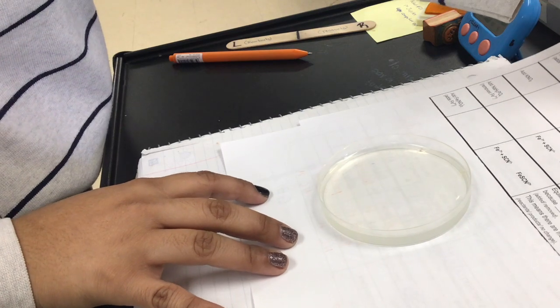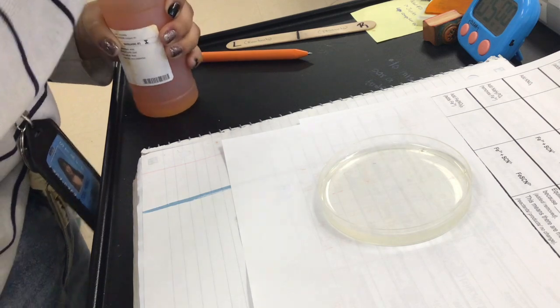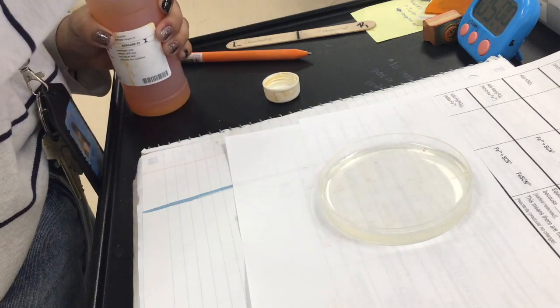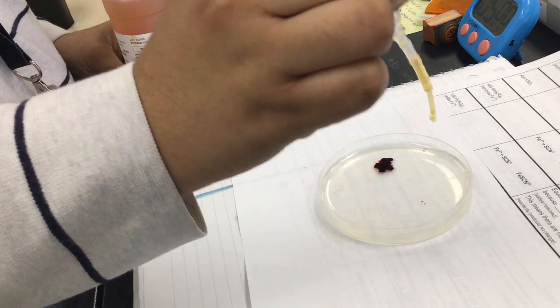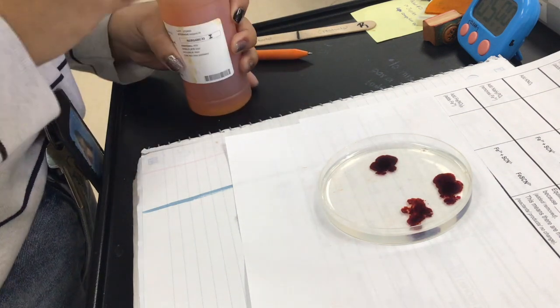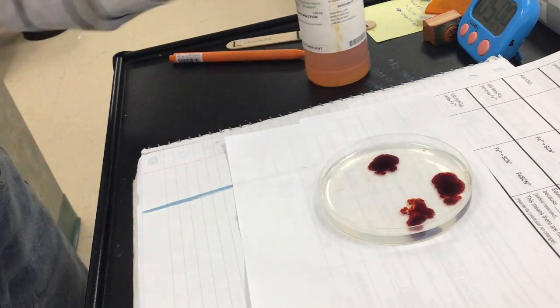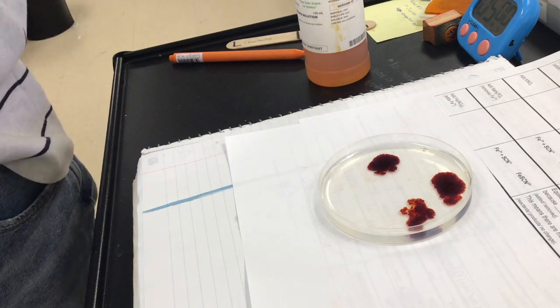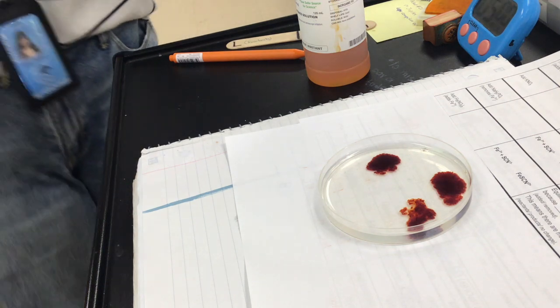Okay, so for our next one, we are going to add Fe, so iron nitrate, to add a little bit more of Fe ions. Okay, so I'm not gonna swirl it. So can you record your observations right there and what you see right there? This is adding iron nitrate. Can you record your observations just from looking at that?